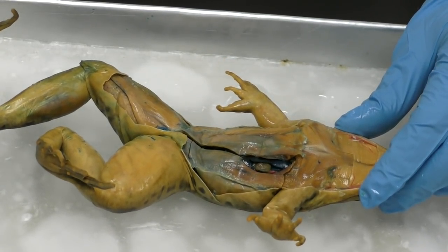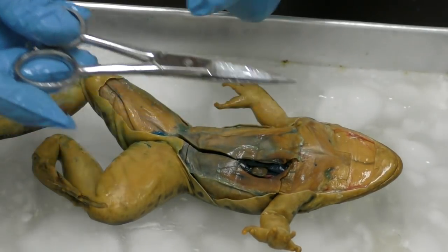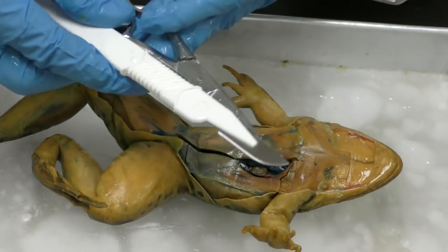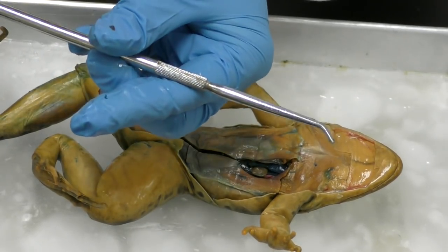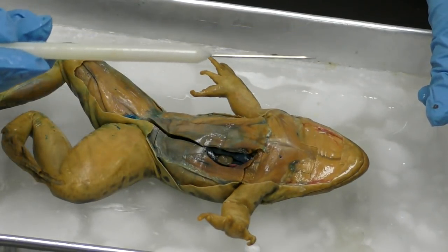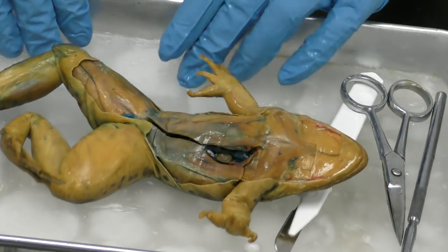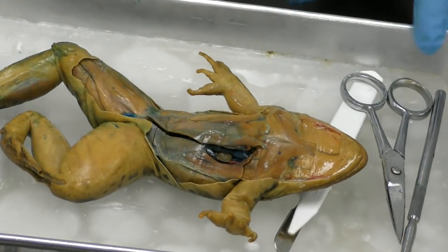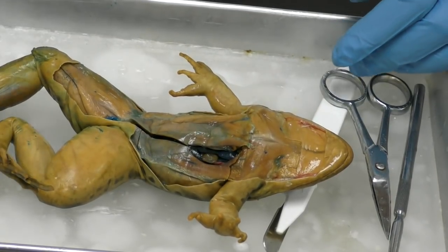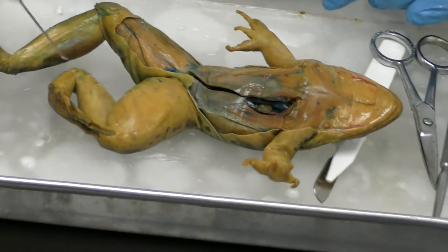The typical tools I would use are scissors, okay, a scalpel blade. So you'll find I use the scissors much more than the scalpel blade, a blunt probe, and a pointer or a pointy probe, okay? And then this tray is a dissection tray that's got wax in it. A lot of times people ask me if it's ice to keep the frog cold. It's not, it's wax so that I can stick pins into it, okay? See how I stuck my probe down into it.